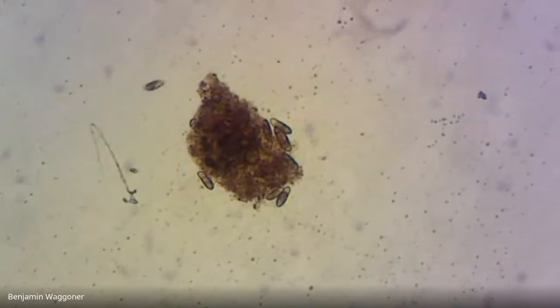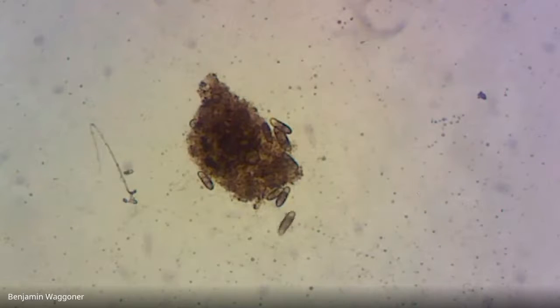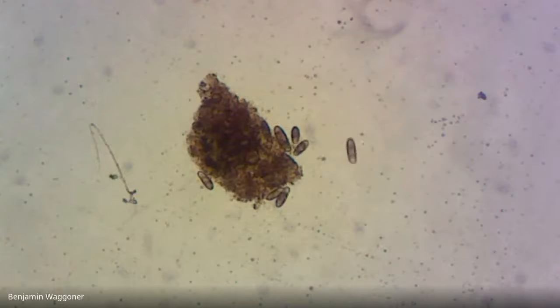Yeah, this is cool. A bunch of little brown ciliates. If they're moving really fast, there's not a whole lot you can do. In the lab, we could add something like nickel chloride to paralyze them, but unfortunately, we can't really do that on remote.